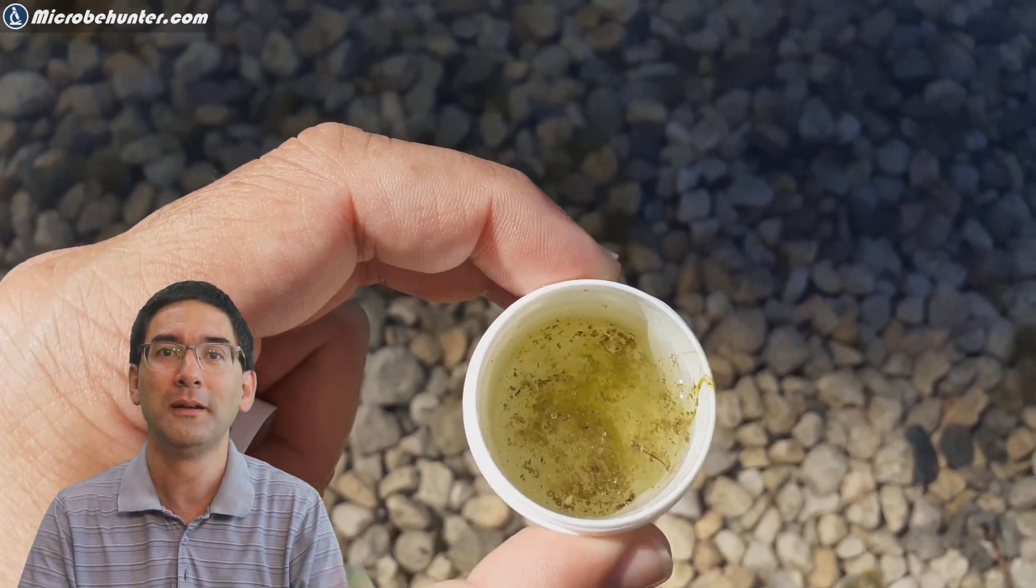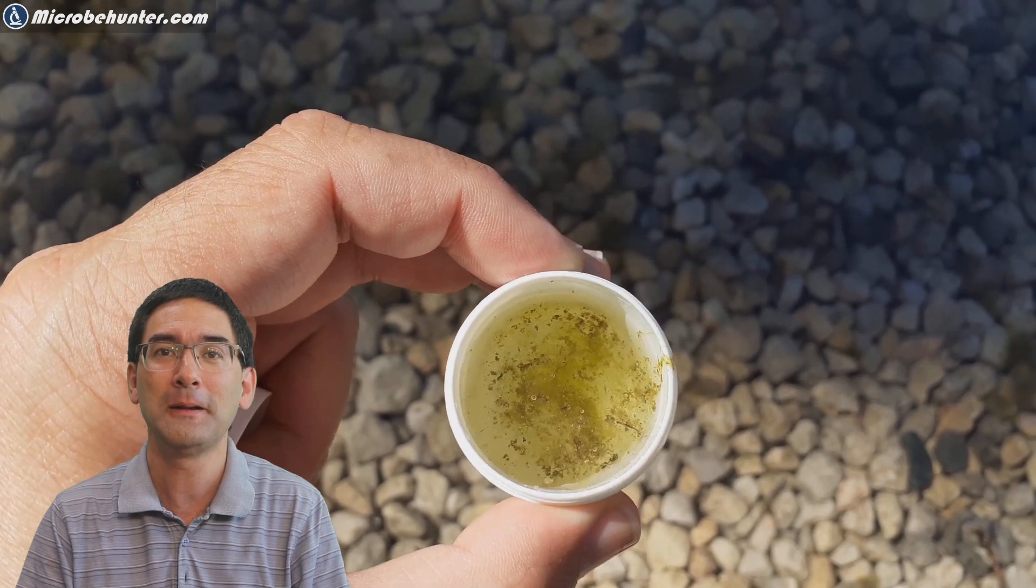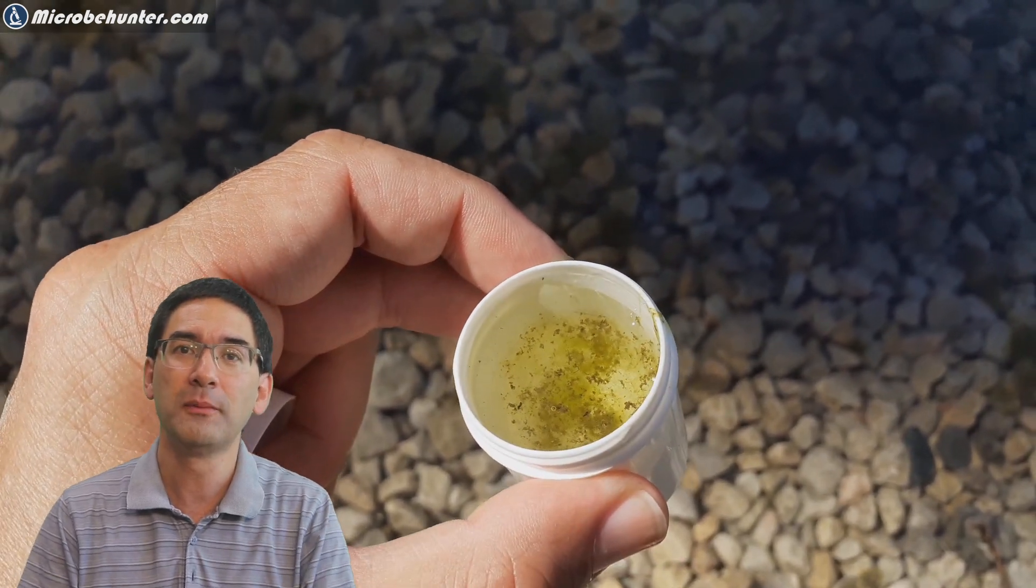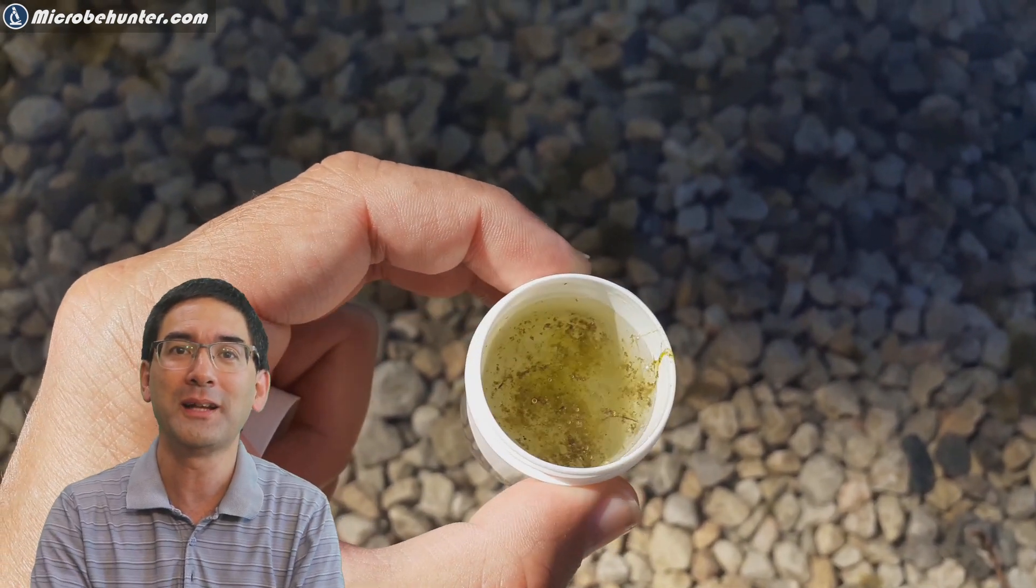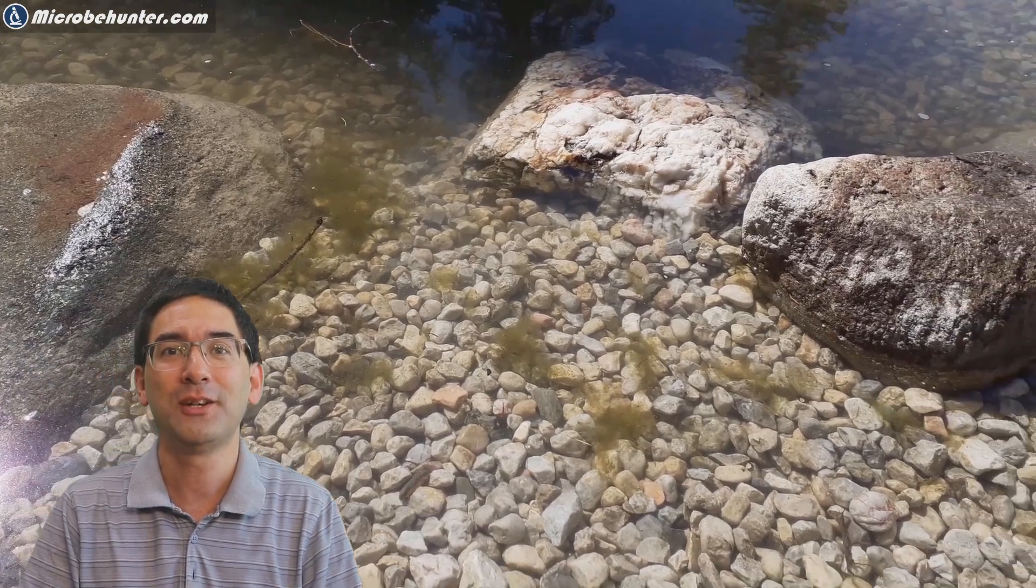Well I always take along a little bit one of these plastic cups and in this case I scooped up some of the sample, put the watertight lid on top of it and essentially took it home and in the evening I put it under the microscope.